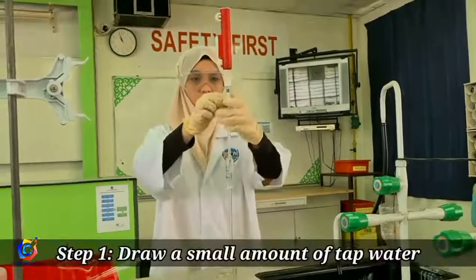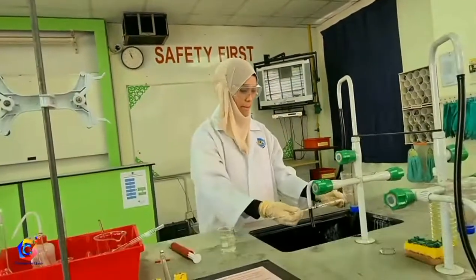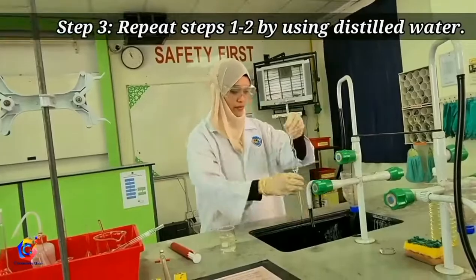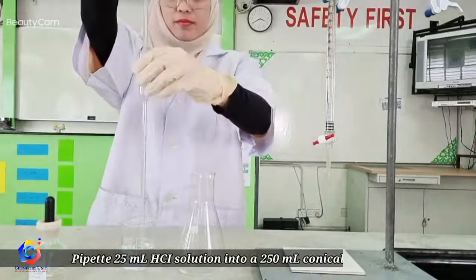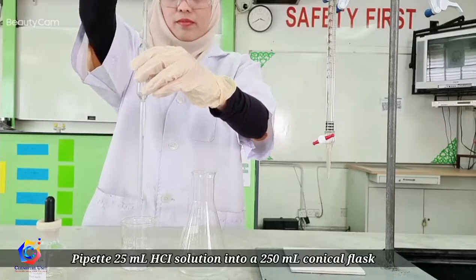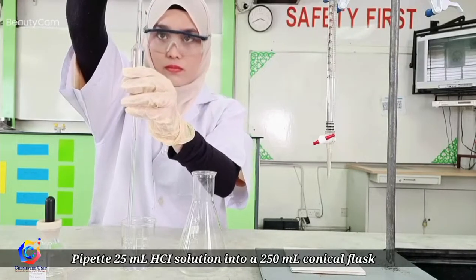Now let's prepare the pipette. Draw a small amount of tap water into the pipette by using a pipette filler. Rotate the pipette horizontally a few times and discard the water. Repeat the steps by using distilled water and the solution to be used. Pipette 25 ml hydrochloric acid solution into a 250 ml conical flask.